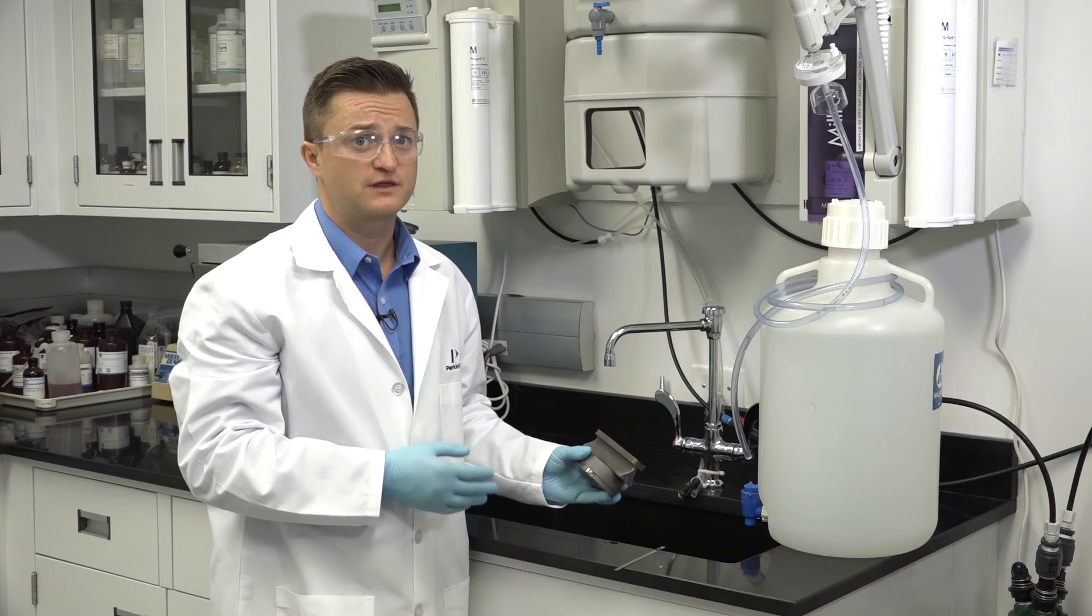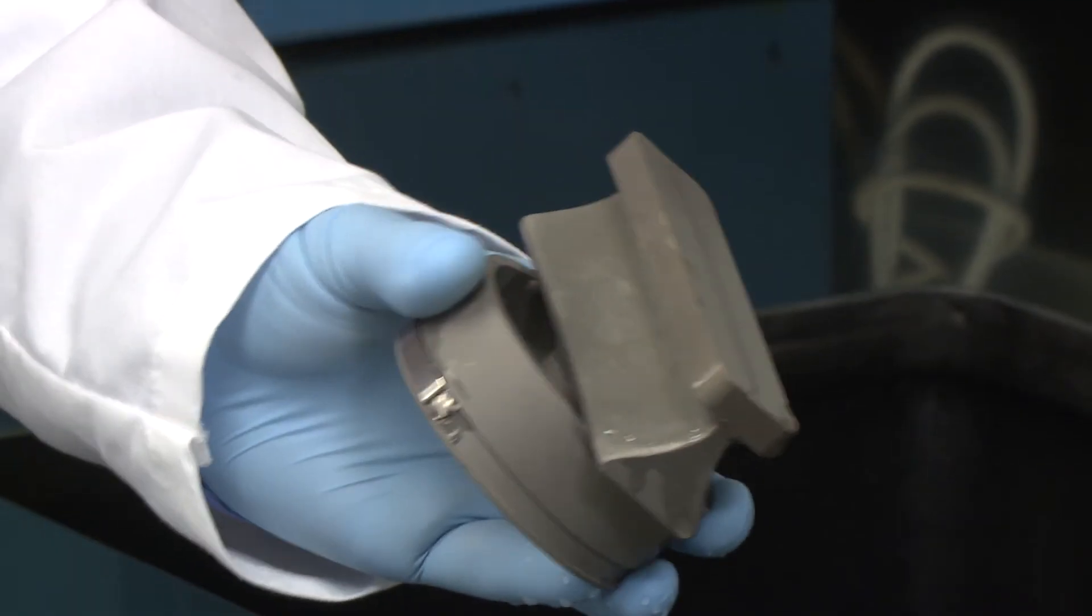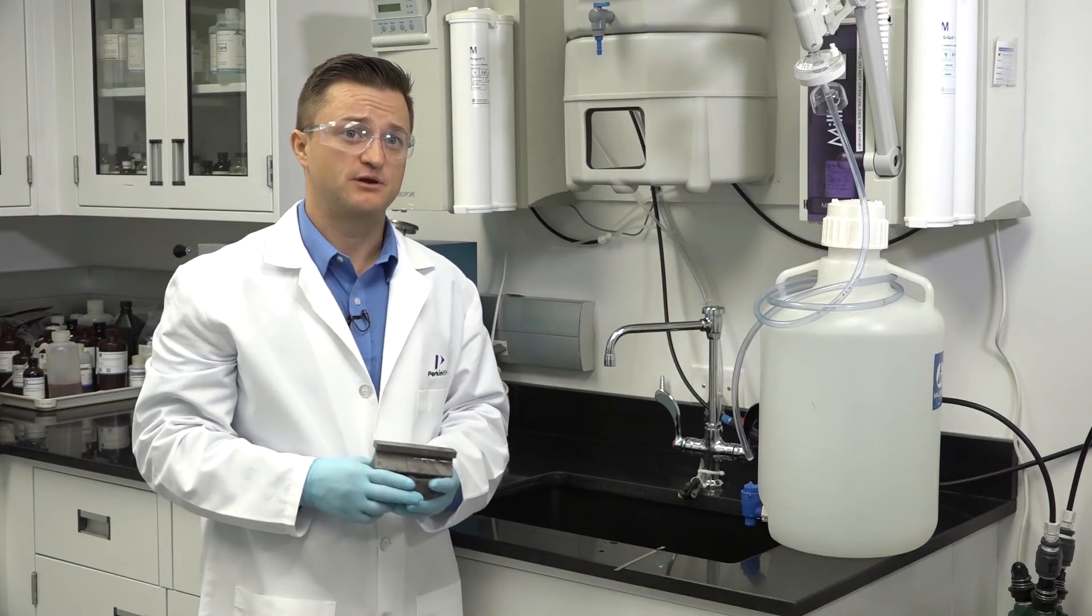Now blow the burner head dry with clean compressed air or allow it to air dry prior to reinstallation. Now your burner head is clean and ready to be reinstalled.